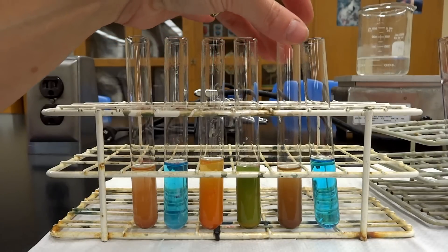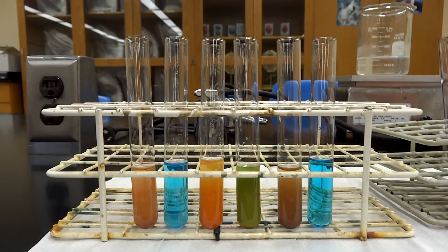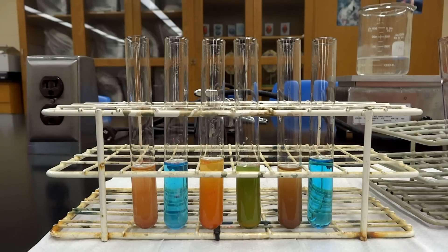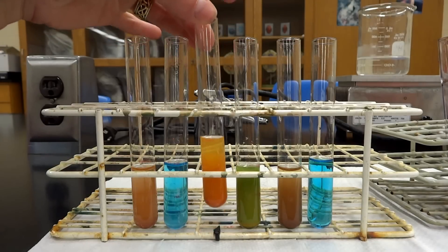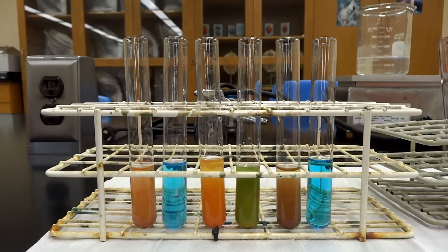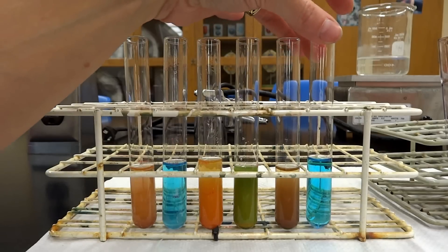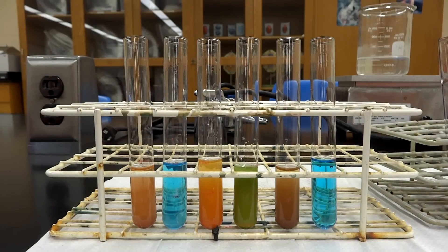You are also going to test four other solutions — what we would call our unknowns — because we don't really know if there's anything in them. We don't know if there are reducing sugars in onions or potatoes, so we have to test that hypothesis. Test tube three is onion, number four is potato, number five is glucose, and number six is starch. You're also going to test an unknown in lab — you have no idea what color that's going to change.